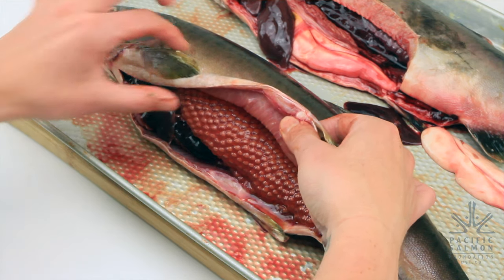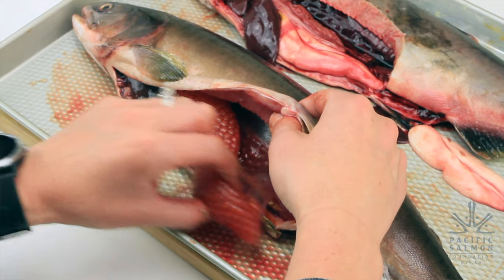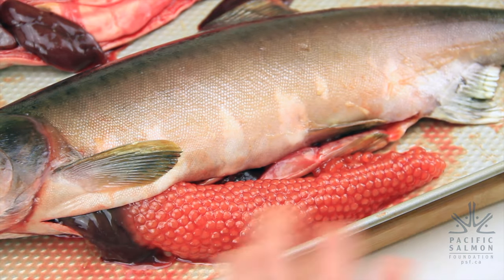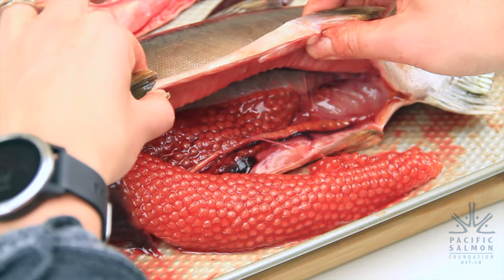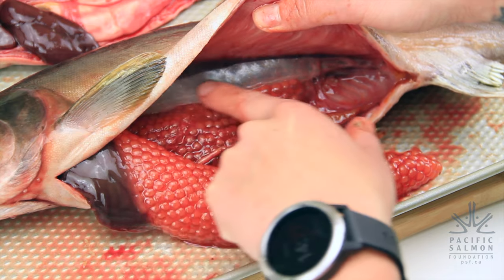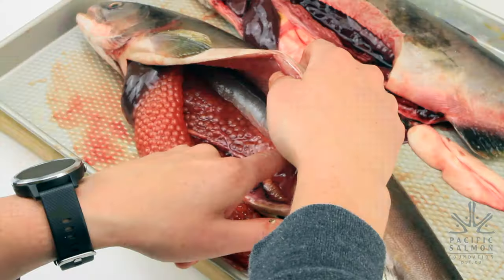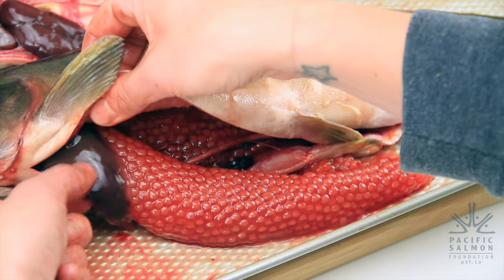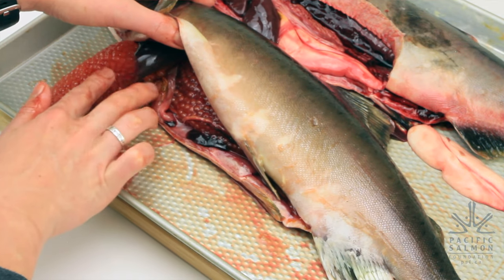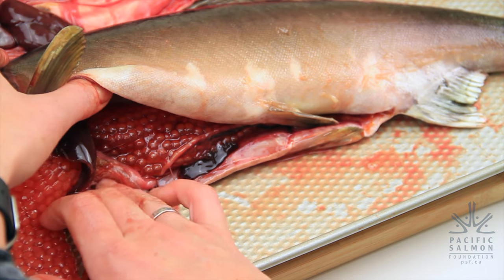You can see that she has lots of eggs! We'll pull this sack of eggs out so we can see all of her eggs. All of the other features are the same — there we can see the air bladder or gas bladder, and behind the swim bladder are the kidneys. What we've got here is the liver. Do you remember what these little finger-like projections surrounding the stomach are called? The pyloric ceca.